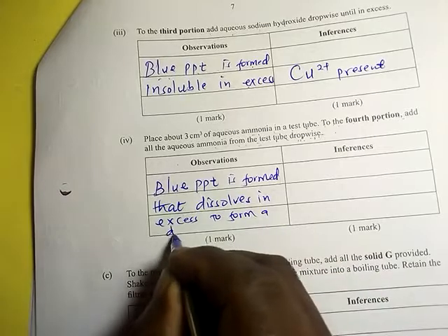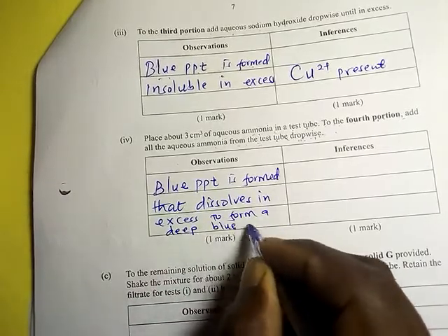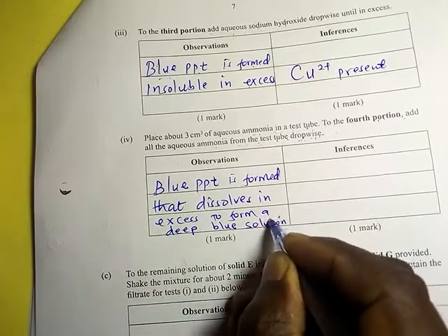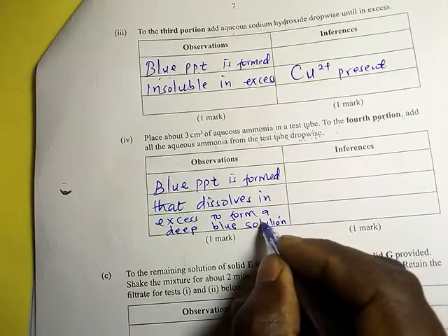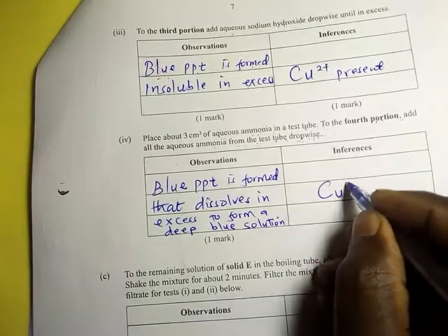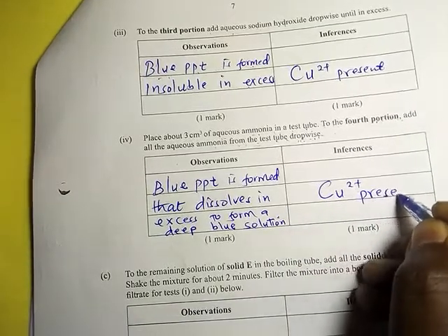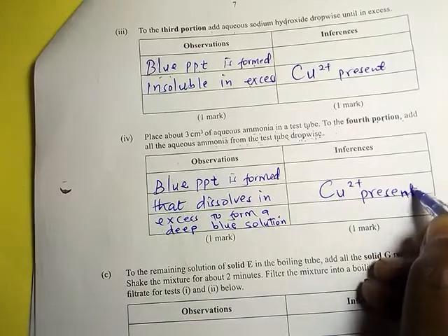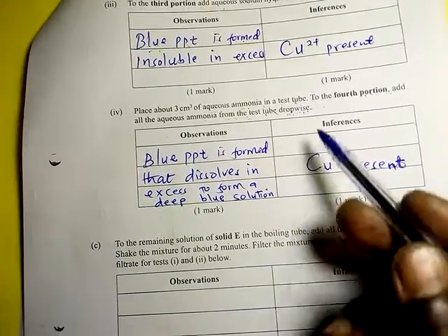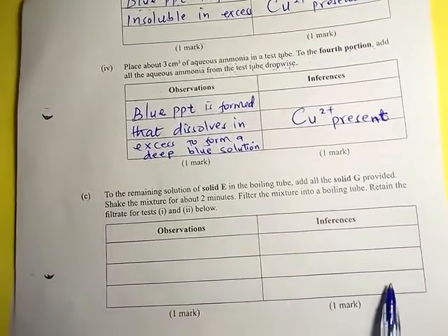The blue precipitate then starts to dissolve in excess to form a deep blue solution. A deep blue solution confirms that copper two ions are present. When you find things repeating like this, don't worry — you are simply verifying, doing the right thing.